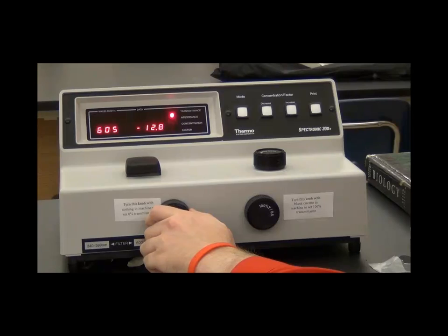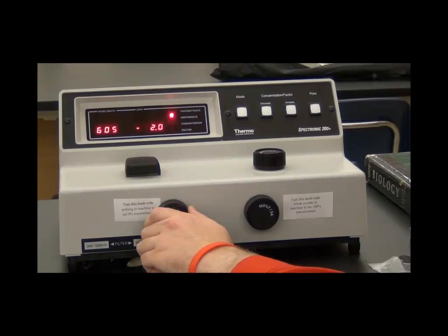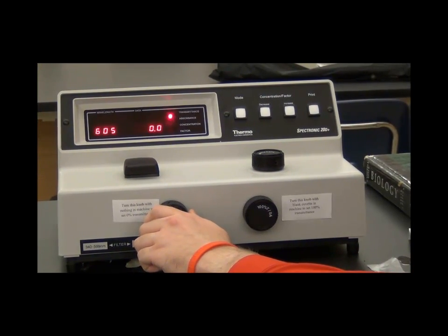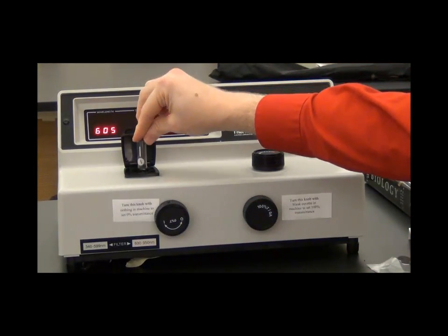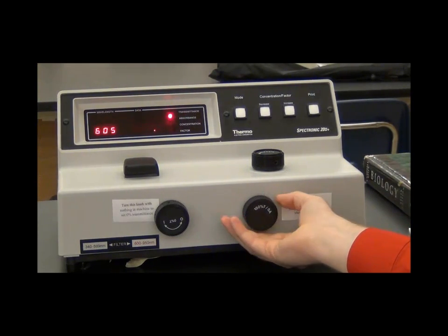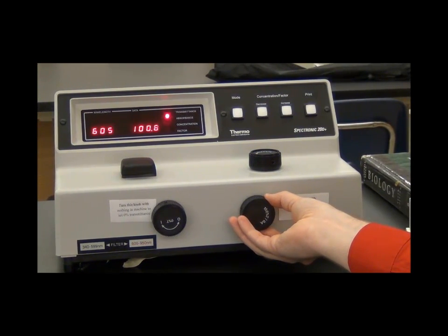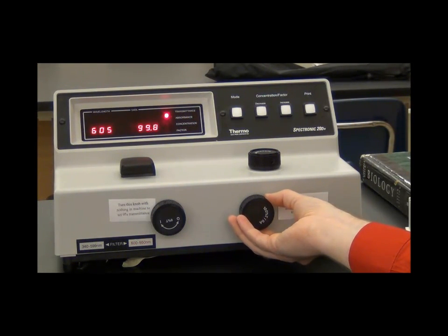To calibrate the spectrophotometer, with nothing in it, turn the left knob to zero. Then put the blank into the spec and tell the machine that should represent 100% by turning the right knob. I've got little signs on the spectrophotometer to make that clear, but you've got to turn the right knob. The Cambridge machines might work a little differently, so we'll talk about that in class.